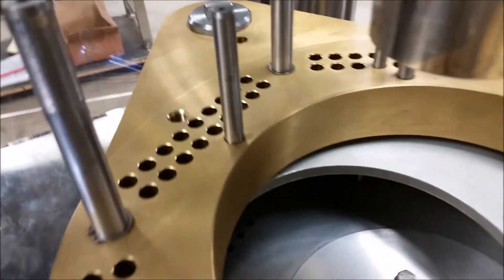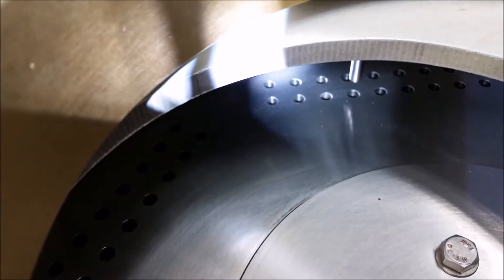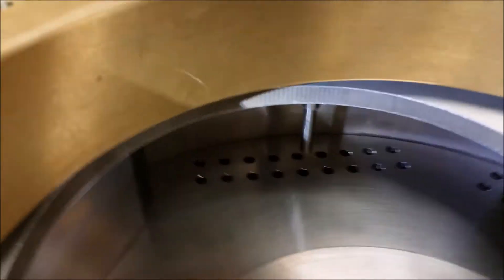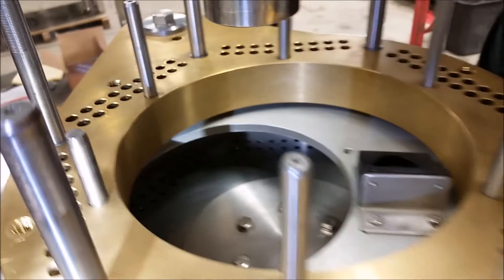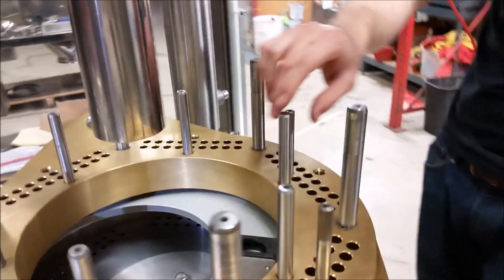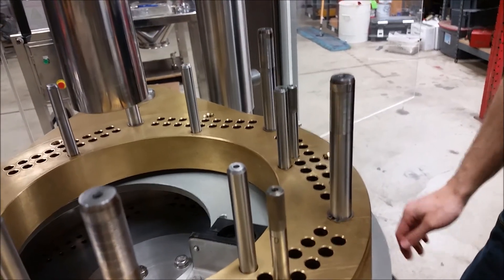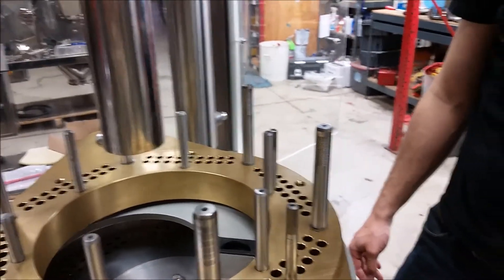After those have been tightened slightly, check your pins again. Make sure they're still working and not giving you issues. You're going to want to check them on the other stations around the disc. If they end up hitting anywhere or having troubles, just loosen those up a little bit in the middle, re-adjust, and re-tighten them down. Once you've got everything finished, tighten down the bolts in the middle and you're set. You can put your tamping stations back in and continue with whatever you need to do.